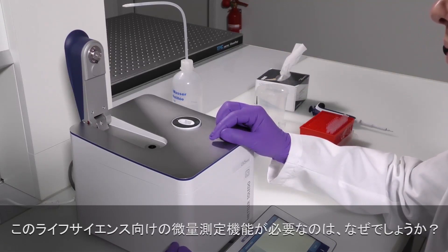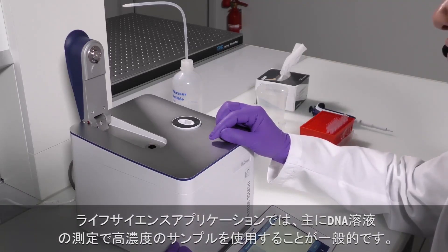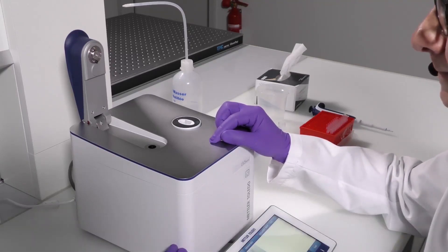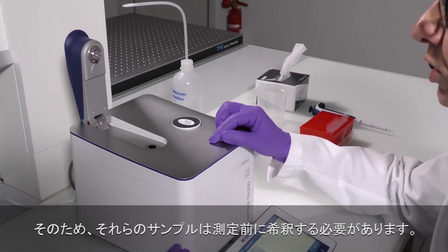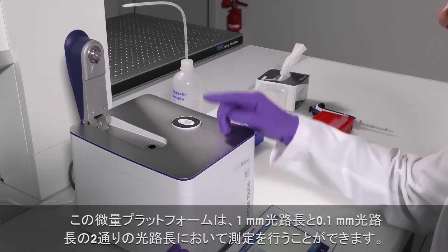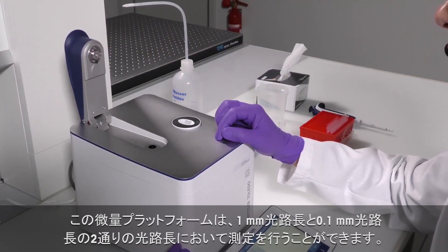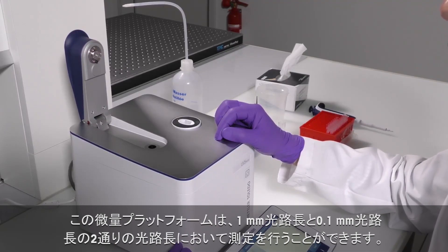Why do we need this microvolume channel in life science applications? In life science applications, mainly when performing measurements of DNA solutions, the samples normally are highly concentrated. And in order to avoid that those samples have to be diluted prior to measurement, we can measure them at very short path lengths. This microvolume platform can perform measurements at two different path lengths: at one millimeter path length and at 0.1 millimeter path length.